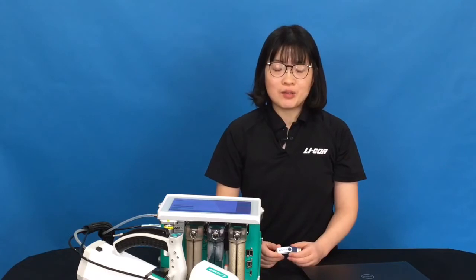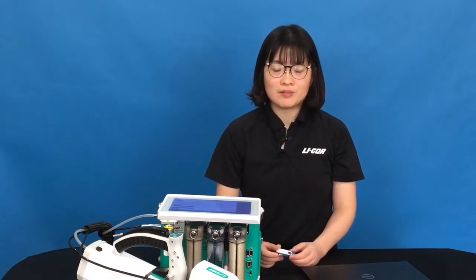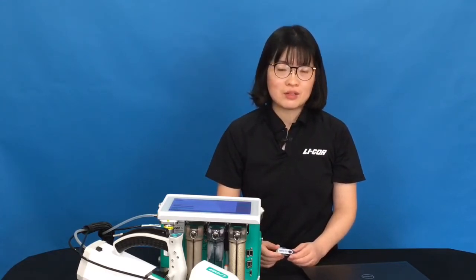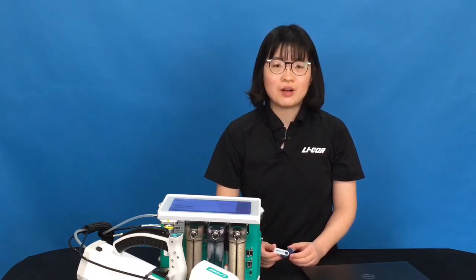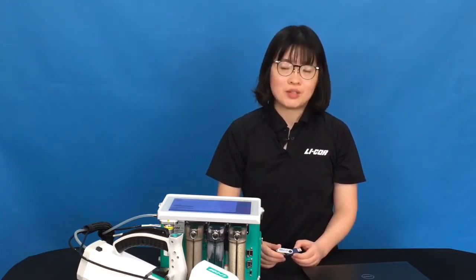We will suggest you make sure you have a USB storage device with good quality and from a company with a good reputation.